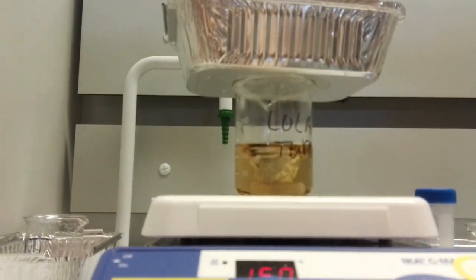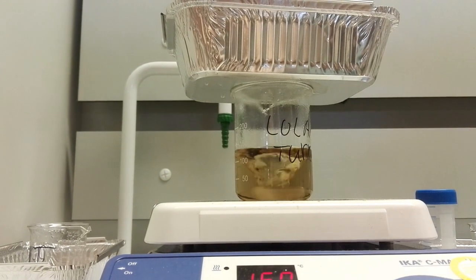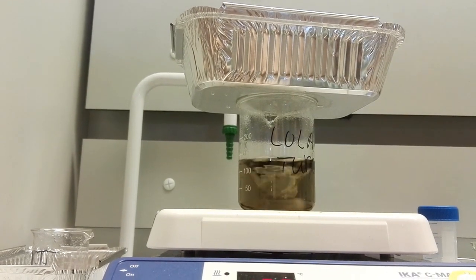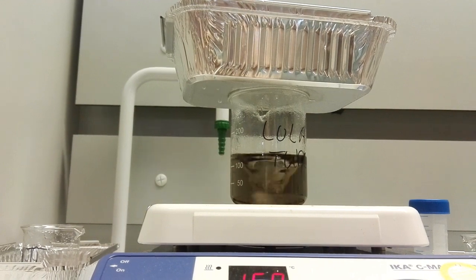This is a grey fluid. How exciting. Secretly, inside this little beaker, a very exciting process is going on. Everywhere in that beaker, gold ions are forming big groups and interacting with each other, kind of like one big group hug. Or rather, a bunch of cars crashing into each other.